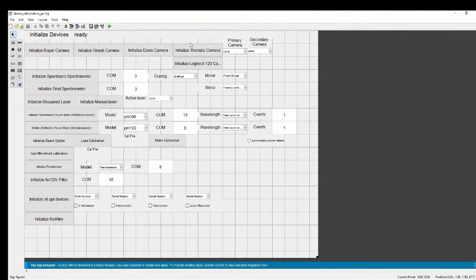Okay, and then that pops this up onto my screen. And let's see, how many buttons are we going to have to make here? Pretty much we're going to copy everything that already exists for the Oriel, but we're just going to rename them, essentially. So it looks like I've got 5 things I need to work with.